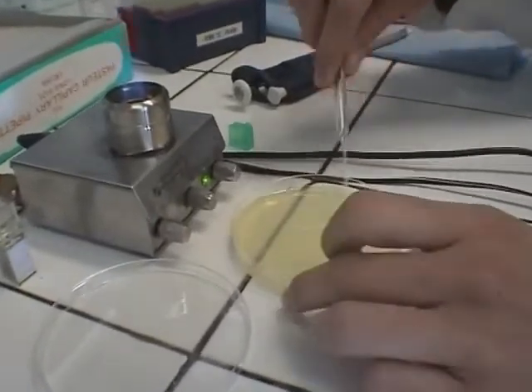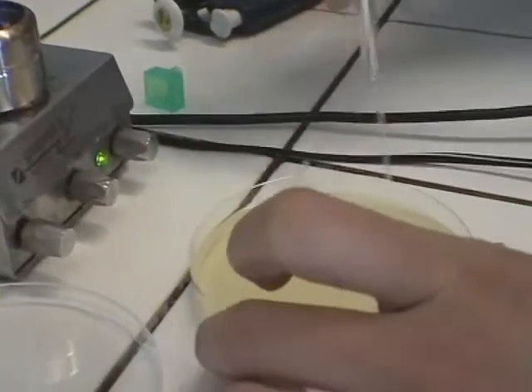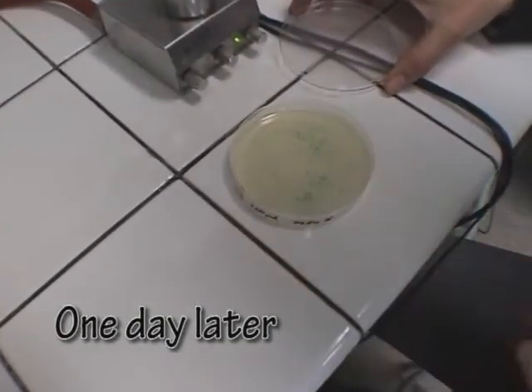Next, the bacteria are spread over a culture dish, and the bacterial colonies that have incorporated the plasmid correctly are identified by their white colour.